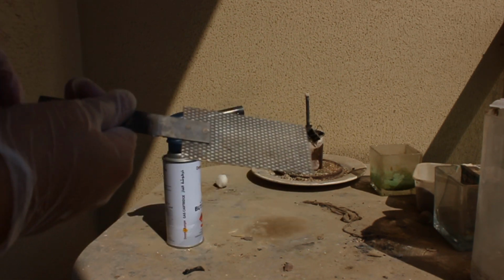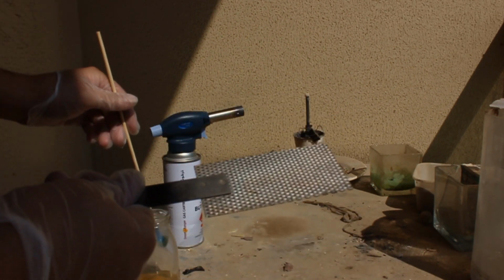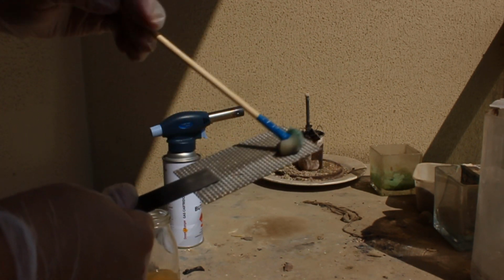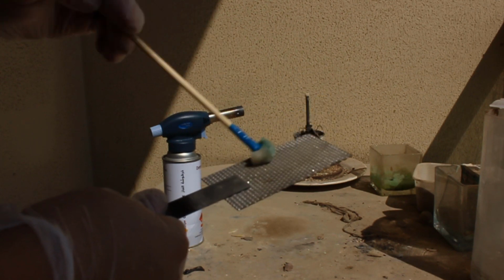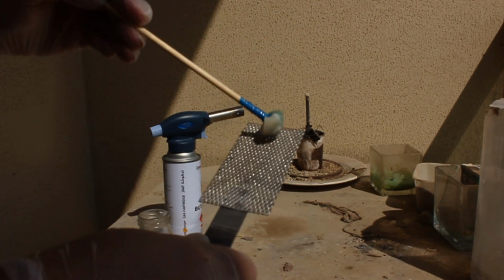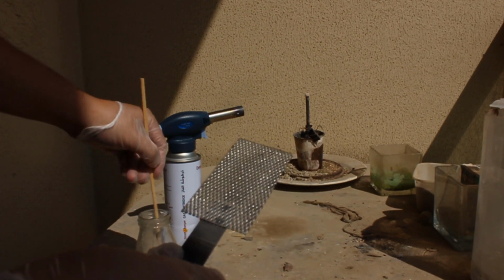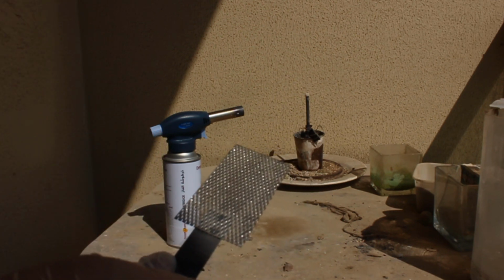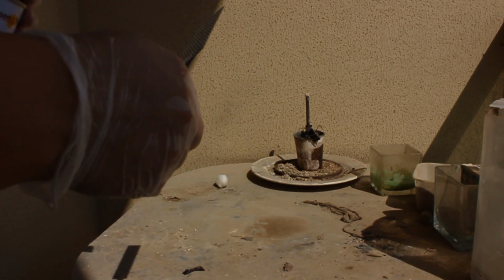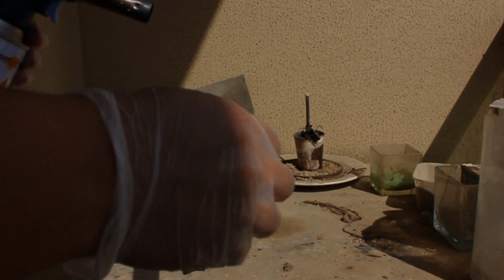That's exactly what we're going to do. You can see there's a bit of the coating there, but that's just one layer. We have to do like 20 more of these. So, paint it again, as usual. It looks bad the first time. It's also good to mix this, so that you mix the fine particles as well. Then, we cook it. Once we blast it, the alcohol burns off, and we're going to get our nice color.